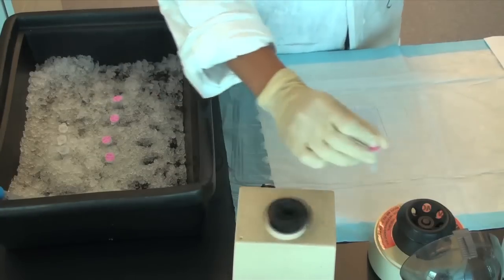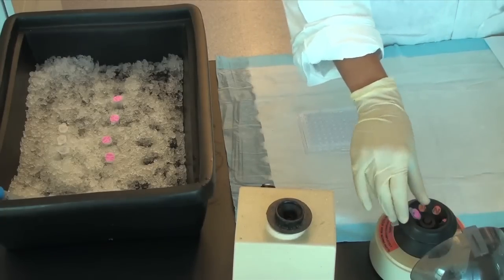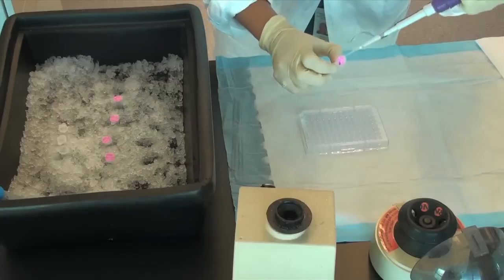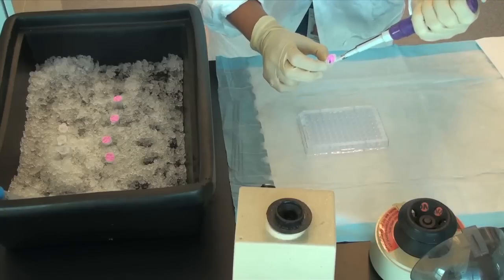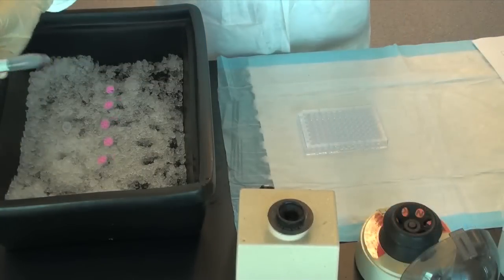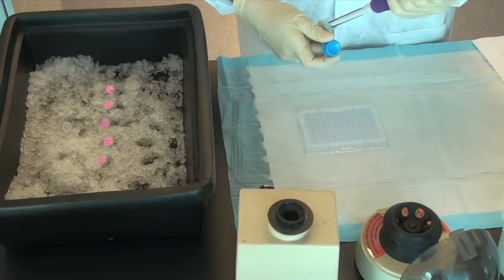Next, 10 microliters of each BSA protein standard solution, as well as unknown protein samples, are transferred onto a 96-well plate and 200 microliters of Bradford reagent are added.